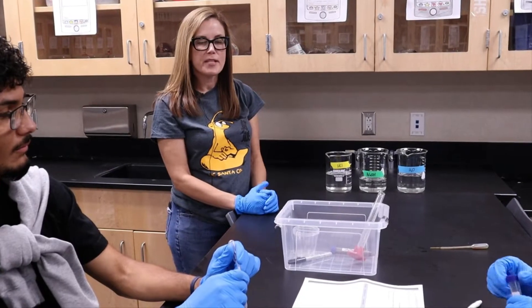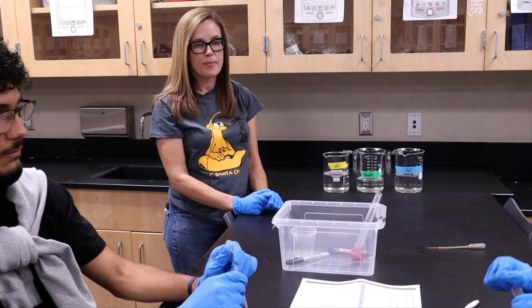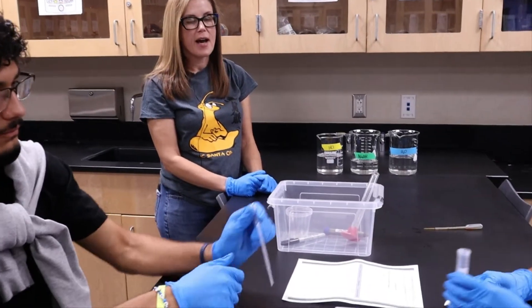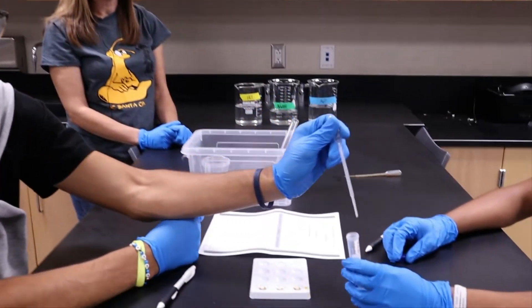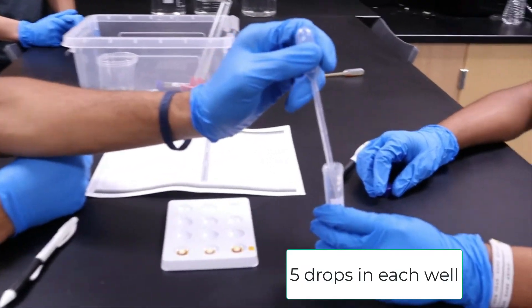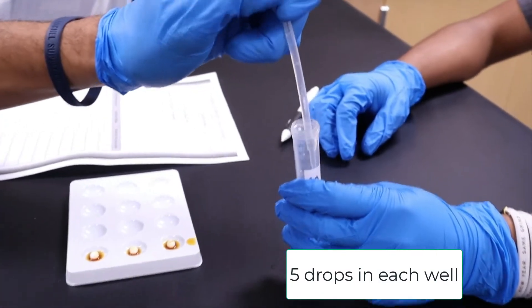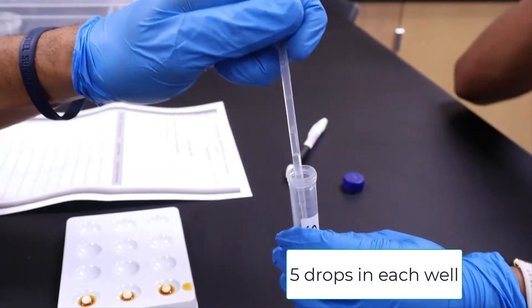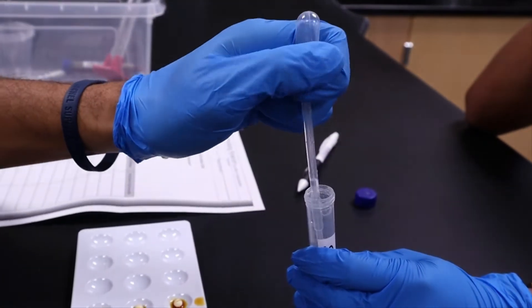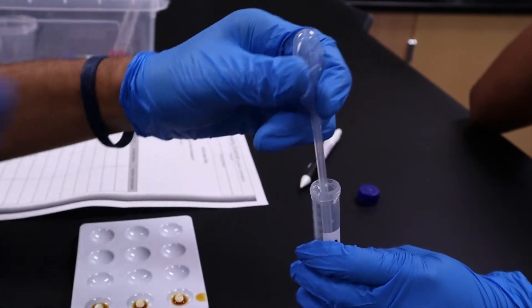The next step in the experiment is to add five drops of sodium alginate to each of the wells. The sodium alginate is a little bit more viscous, so it might take a little bit to get it into the squishy pipette. It will work — don't give up.